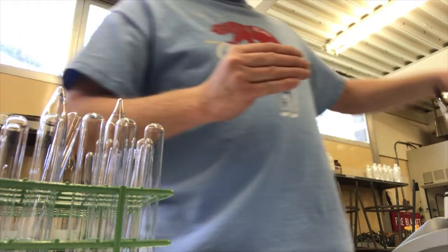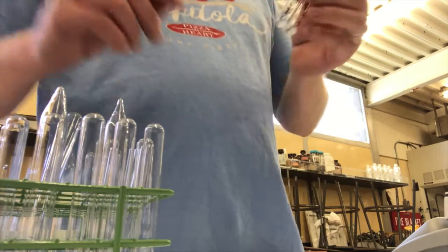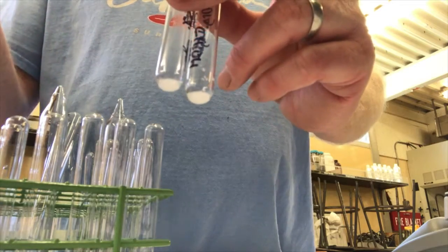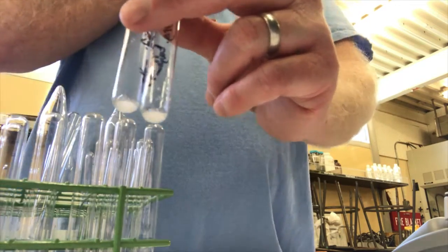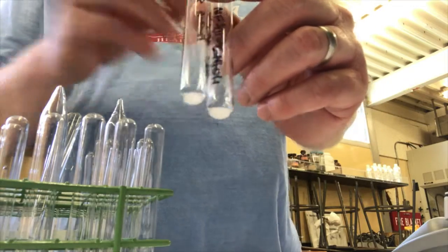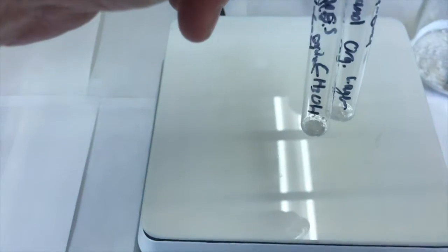There is something to consider here though, something to watch and think about. The methanol has a lower boiling point. It's only a 1 carbon alcohol, so as I heat it, it's going to evaporate quicker. So I'll have less methanol if I heat it for very long. I have to consider that. If I have less methanol and it's looking the same solubility, then it must be more soluble in hot methanol. All right, let's go over to the hot plate and check it out.